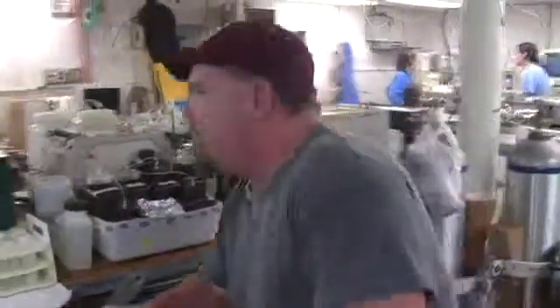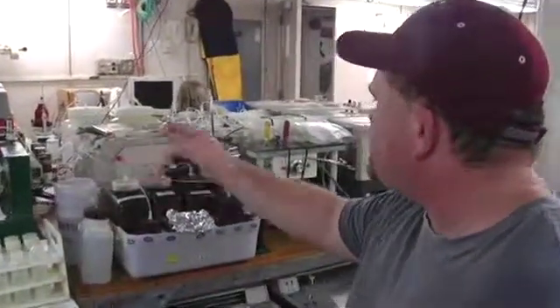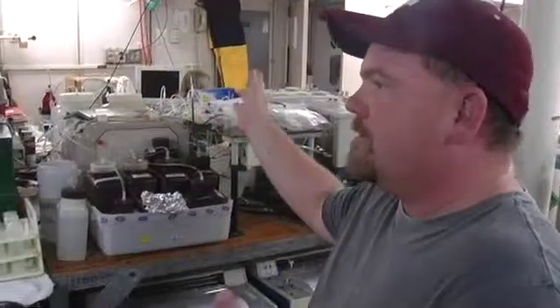For the most part, we've simply loaded the carousel with our samples. As you can see right now, the probe is drawn to sample, and it goes through this manifold, split into four different channels.